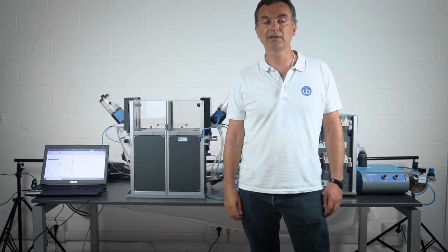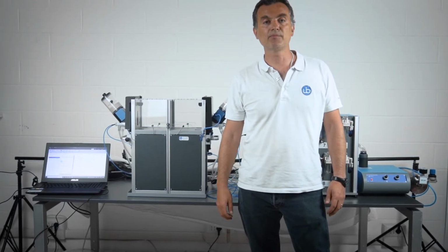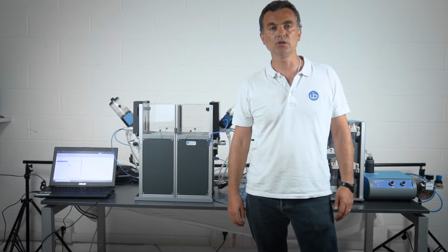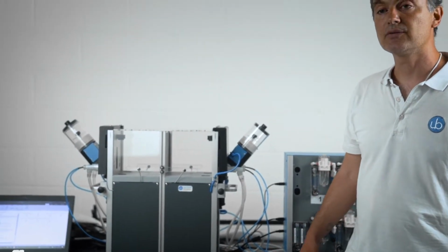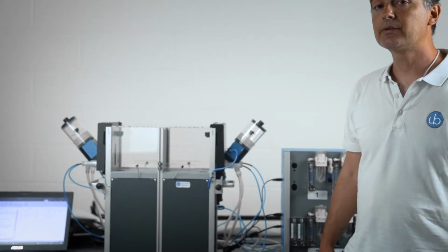Intradimensional and extra-dimensional attentional set shifting is a very important technique that is used in humans with tests like the CANTAB or the Wisconsin Card Sorting, and is also used in mice very frequently, most of the time in a manual and time-consuming manner. What we're showing today is the Ugo Basile Operon, which we developed together with the Italian Institute of Technology, which is a system to automate the attentional set shifting experiments with 3 dimensions.